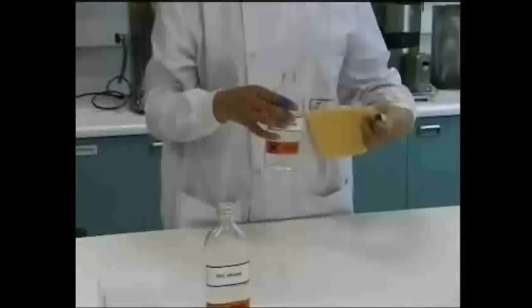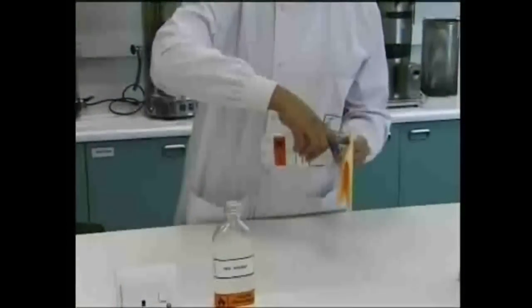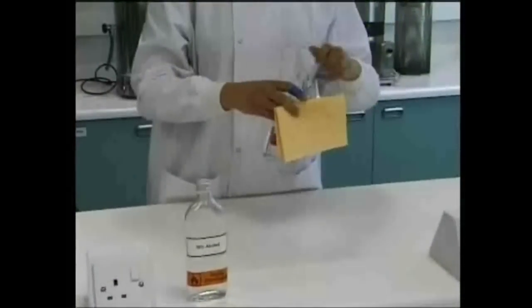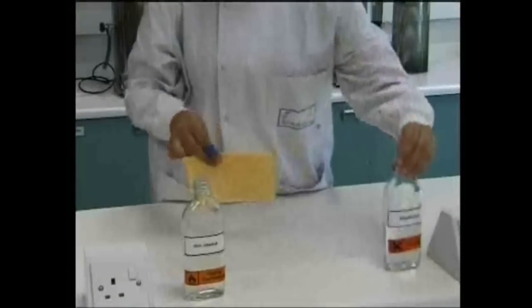Before starting work, wipe down the bench surface with a suitable disinfectant. The bench surface must be non-absorbent, so appropriate covers may be needed.